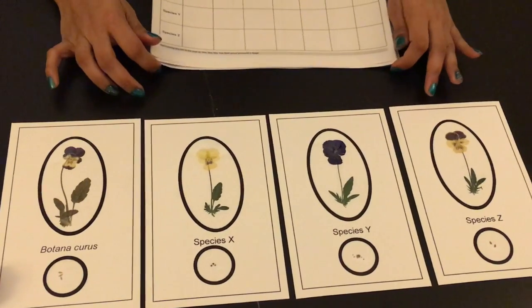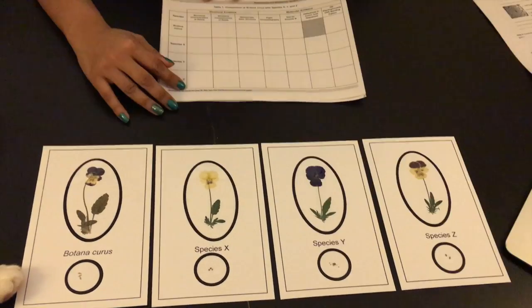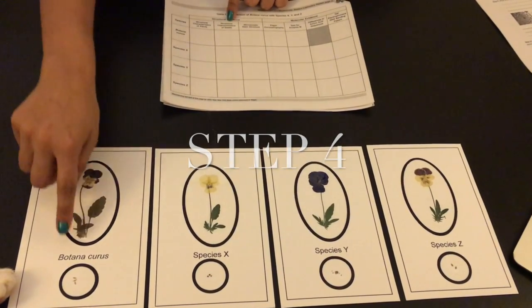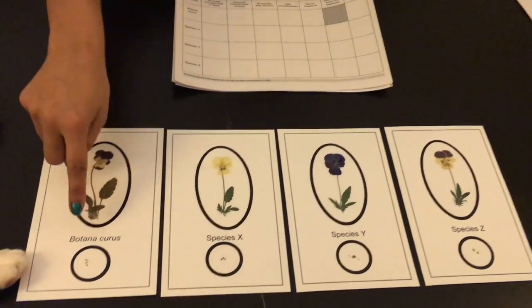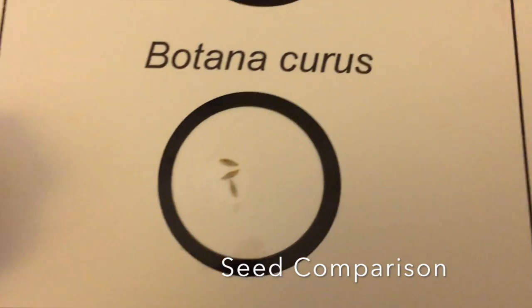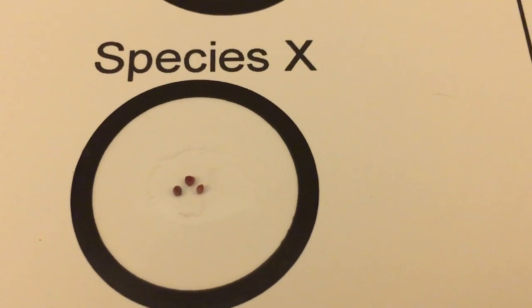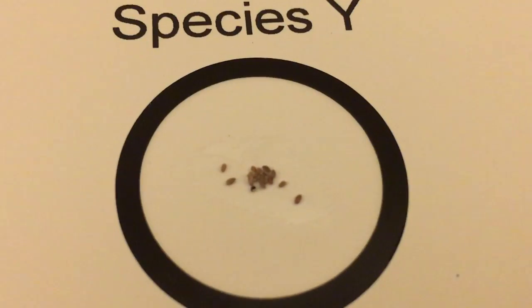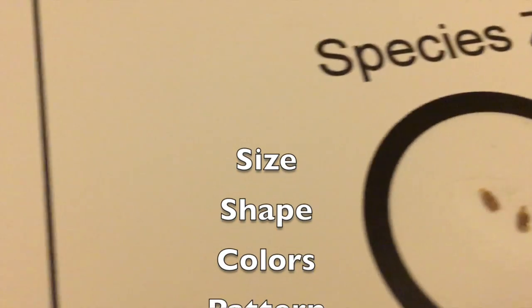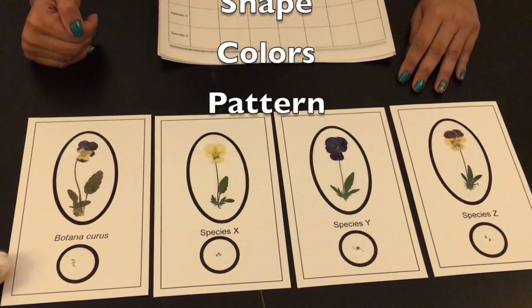Column two will use the same papers and the same layout, and will now compare the seeds of each plant to find similarities. Things students can note include the size of the seeds, the shape of the seeds, the color of the seeds, and the patterns in the seeds.